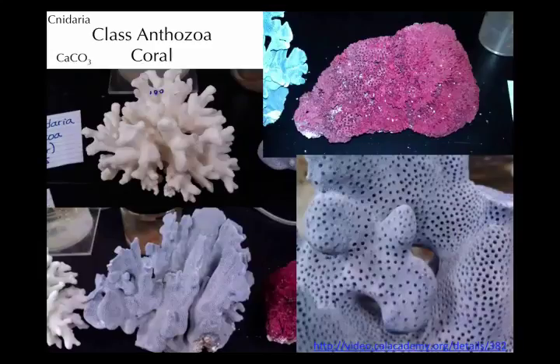Third class of Cnidaria is Anthozoa, which include the corals. So they are animals. Now we're not really seeing the real animal here. The real animal lives in the holes. We're just seeing the skeleton, the calcium carbonate skeleton of the animal. So basically it's secreted by itself. The animal secretes it. It doesn't go find a rock and then bore into it. It actually makes this shell sort of idea and encases it.